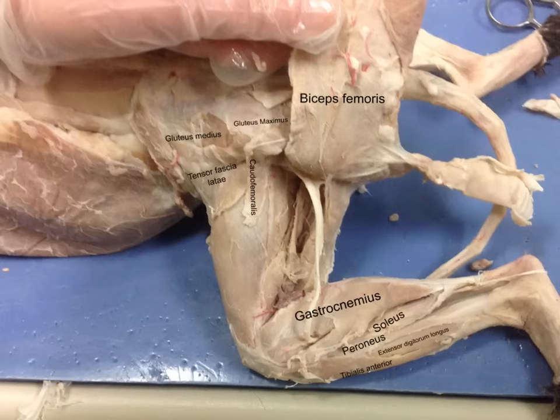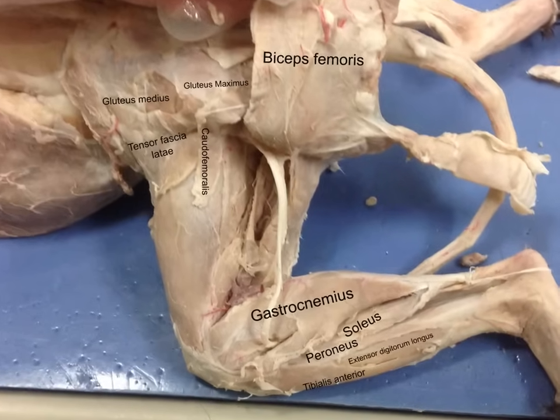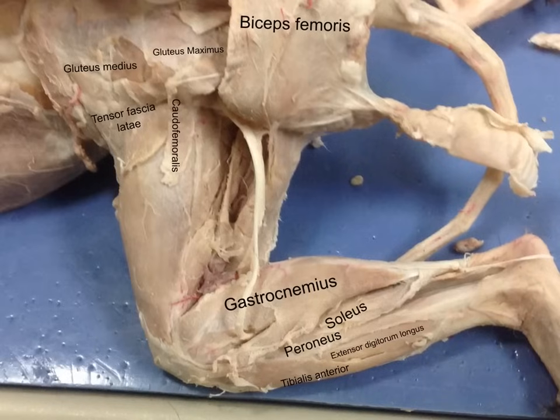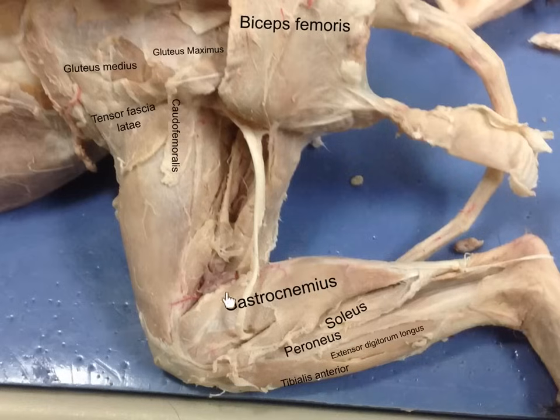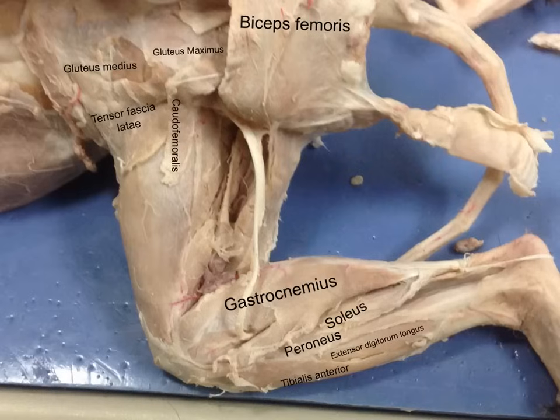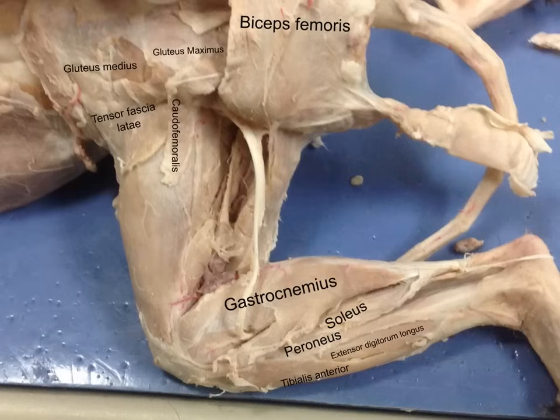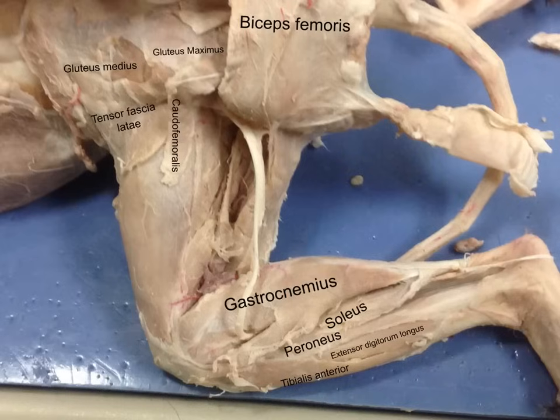This is the view with the biceps femoris reflected. I'll try to zoom in just a little bit more. So if we look at the calf from this view: the gastrocnemius, then the soleus, peroneus, extensor digitorum longus, tibialis anterior, calcaneal tendon, and the biceps femoris flipped or reflected.